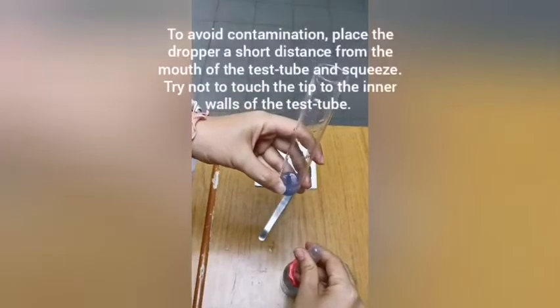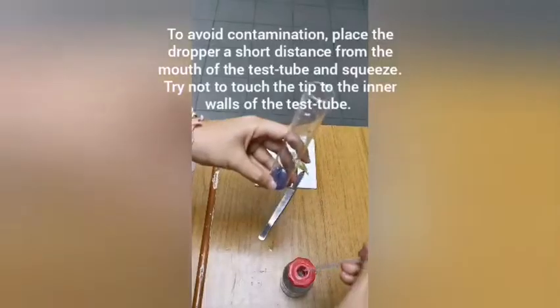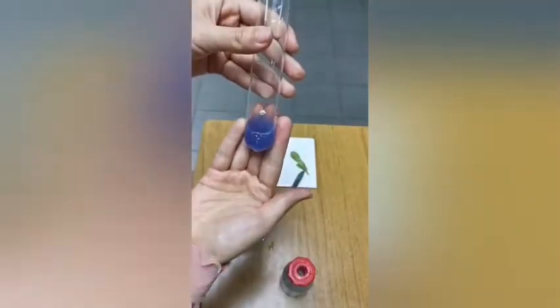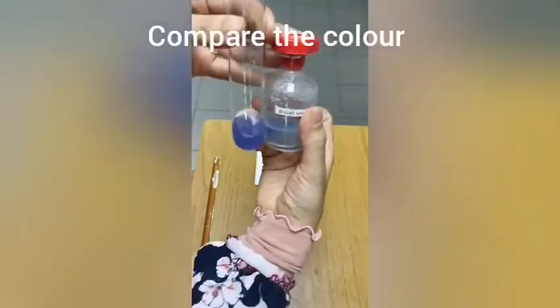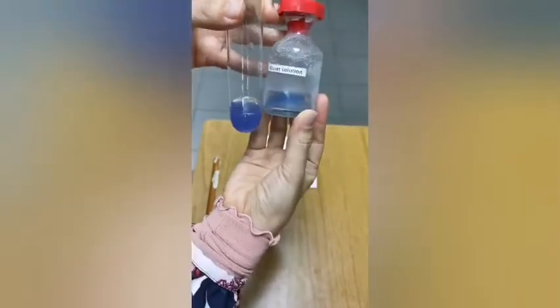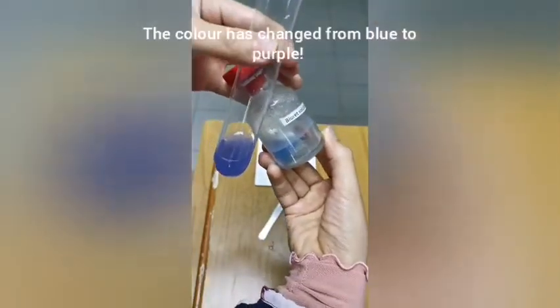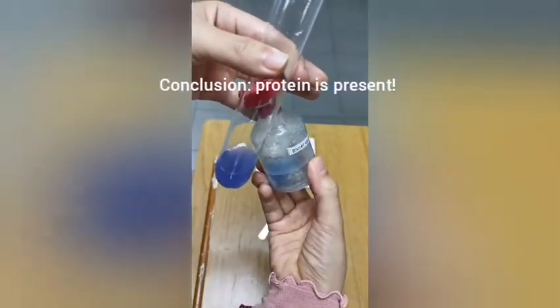To avoid contamination, I don't touch my dropper to the test tube, just hovering above and squirting. So I have about equal volume, and look at the color change. It has turned from blue to purple. This was the original color of biuret. It's quite similar, but I think you can tell the difference between the blue biuret solution and purple. So there is presence of proteins in beans. Beans are a good source of proteins from plant sources.